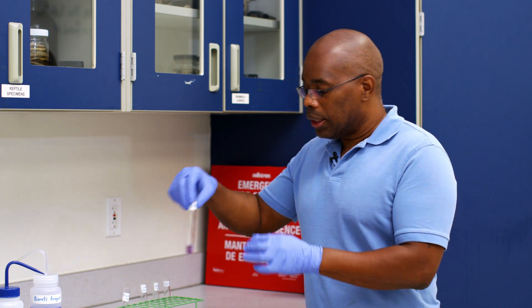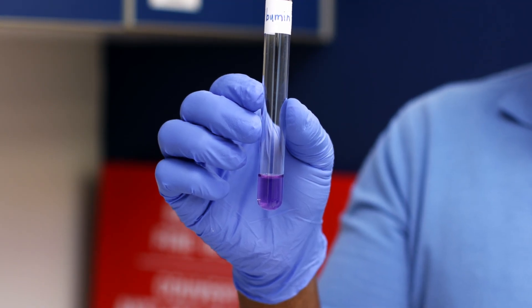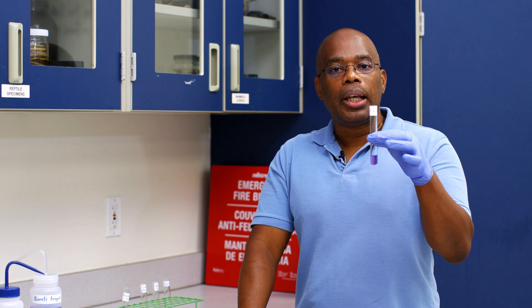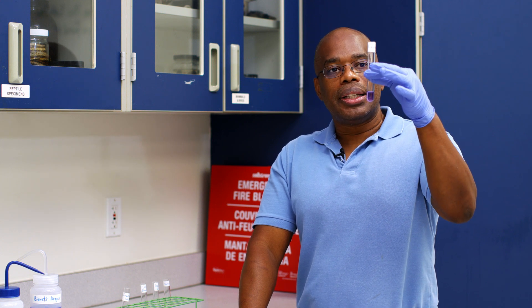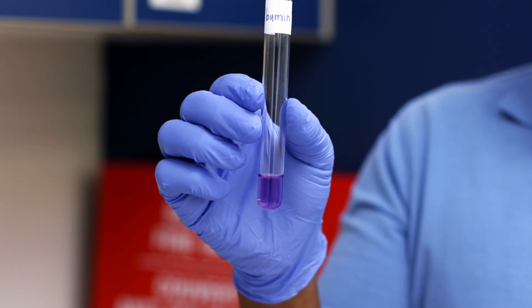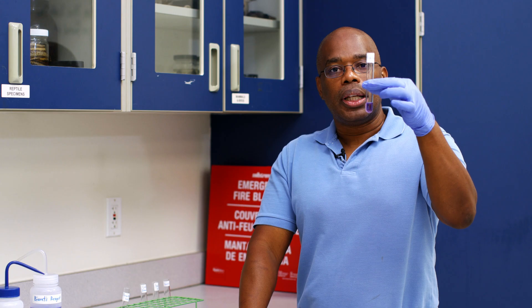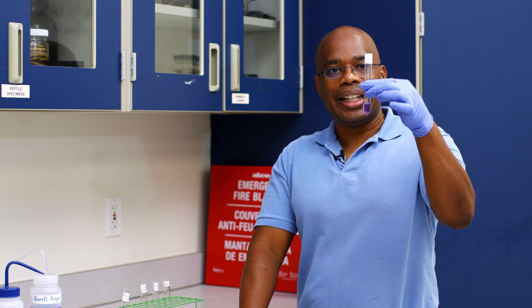Our next solution is albumin. When you think about albumin, I want you to think about egg whites. Egg whites, as we know, are a good source of protein. So as we see with albumin, we see a nice purple color. This is a positive control — this solution has protein in it.